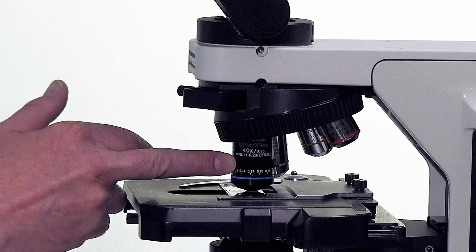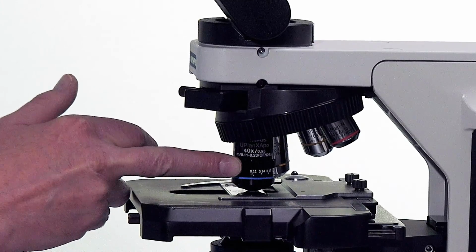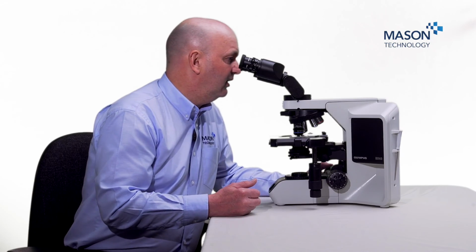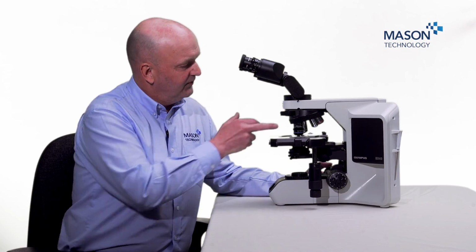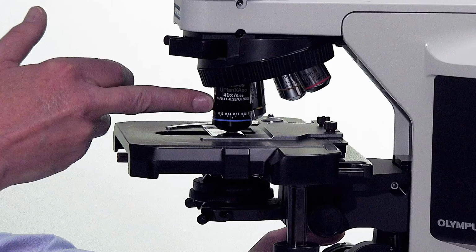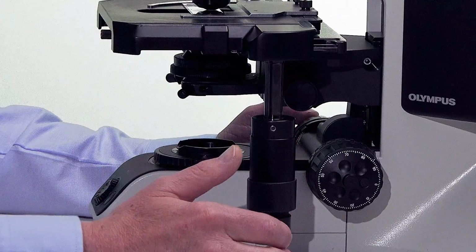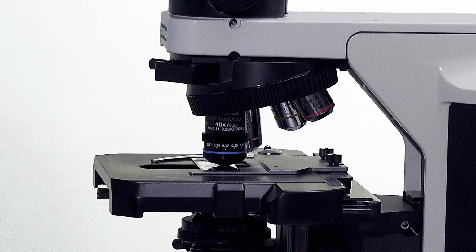This would be one of the more common reasons a customer might call. For example, they may have set this to 0.11, which is the lower limit, and now they're looking down the microscope and see a really fuzzy image. So always start at 0.17. Focus on your specimen. Try going up, try going down, and refocusing. And once you have that right, you should get the optimal position for your objective.